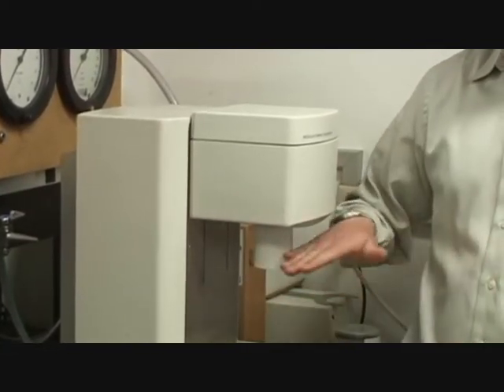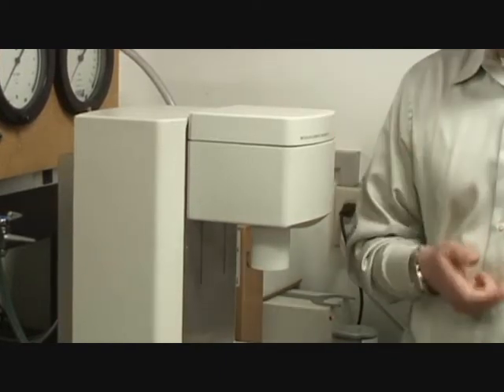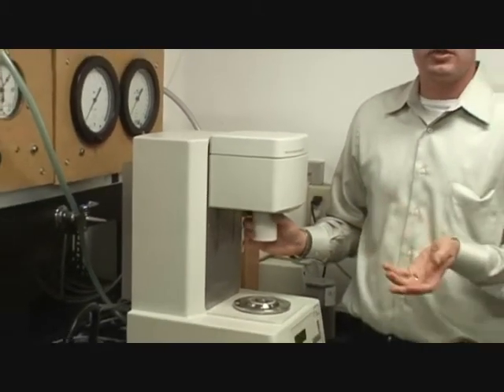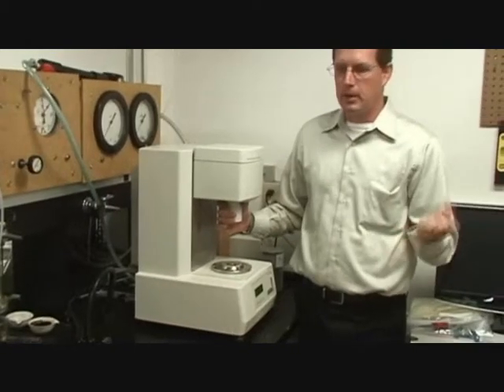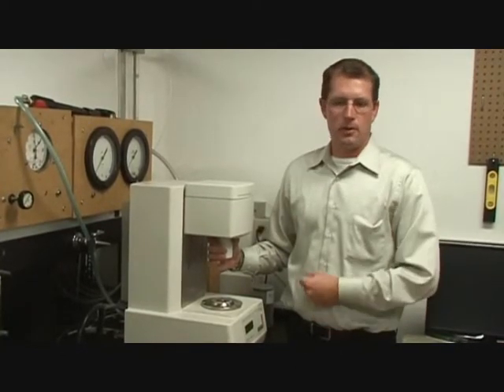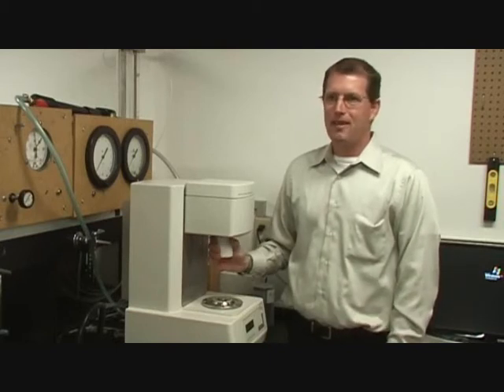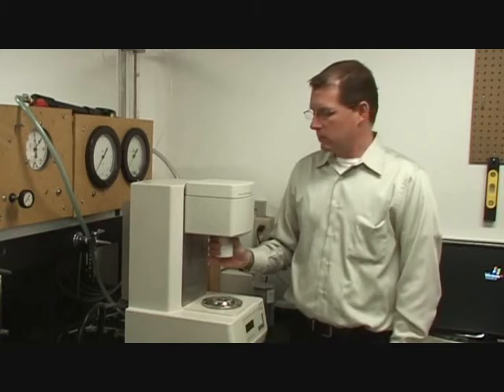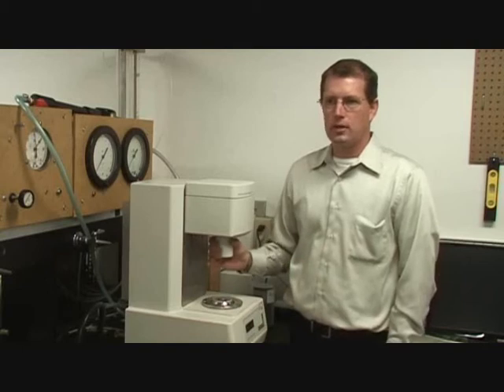The nice part too is that even if you have it on air, accidents happen in a lab. Someone's turning around and they go to strike this. Lateral forces can damage it too. When it's on air, it protects it some. I made the point earlier, if I gave someone 10 minutes alone in any lab and told them to find a way to break as much as they can, they could. That said, we also know the right ways to take care of things, so when doing normal laboratory activities, take care of it. I would just say put this on when you're not using it.